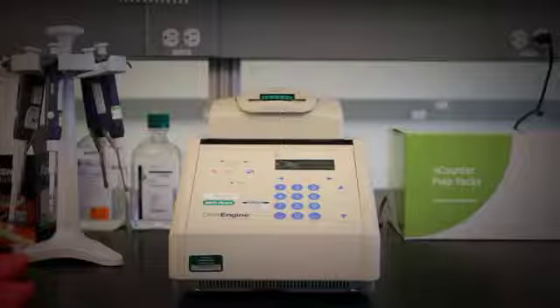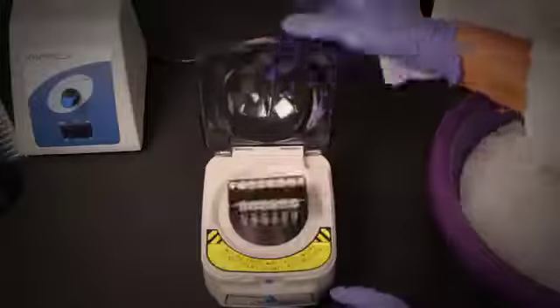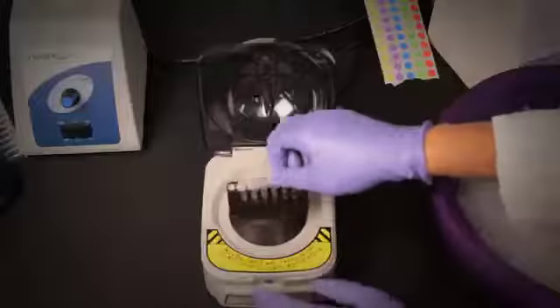After an overnight incubation, check each one of the tubes to make sure that there hasn't been evaporation overnight. Spin down the tubes briefly in a picofuge to collect any condensation down to the bottom of the wells and proceed to processing on the prep station.